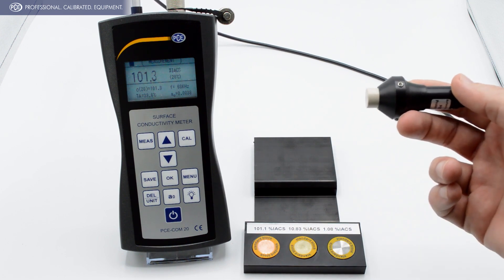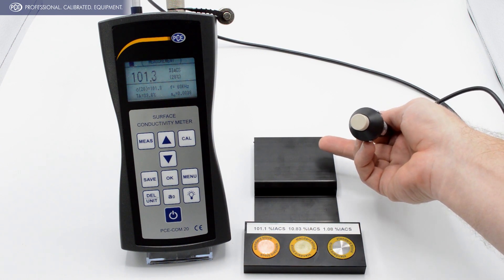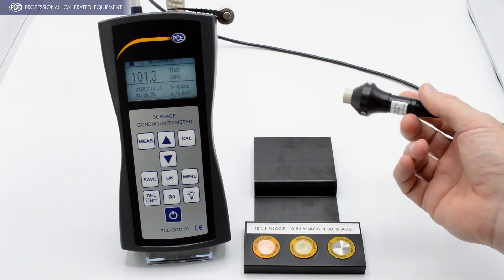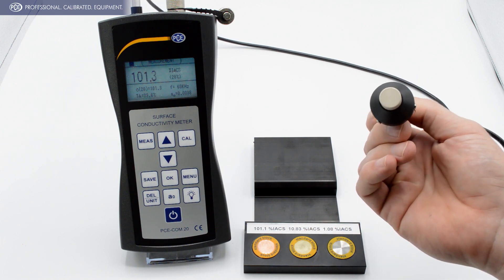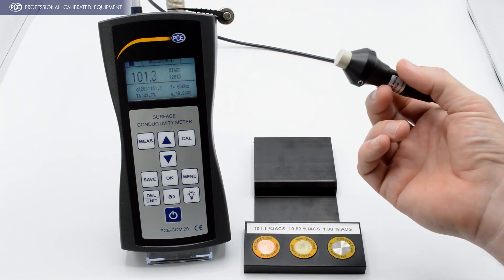A couple of important things to keep in mind is you want to have the same temperature with the probe and the sample that you're going to be testing. So you want to have temperature equilibrium. Another thing is you want to keep the probe tip clear, don't touch it with your fingers and keep it clean.